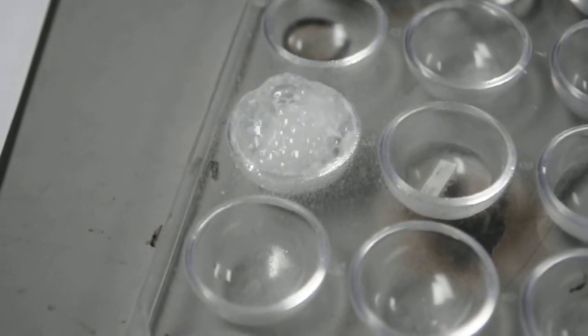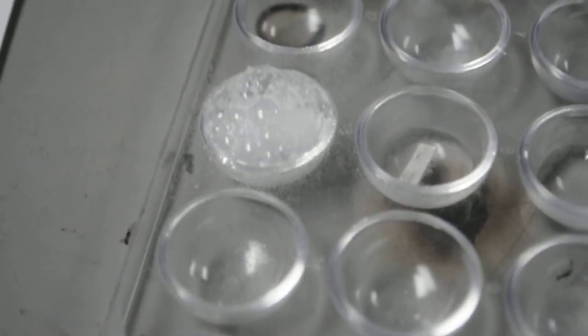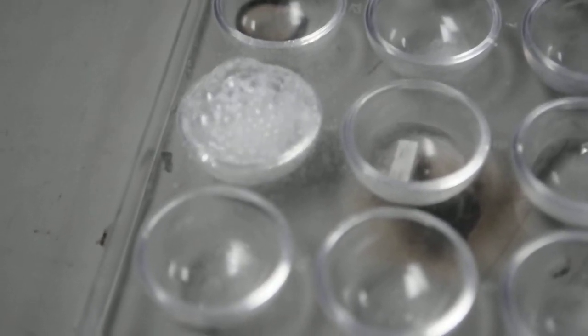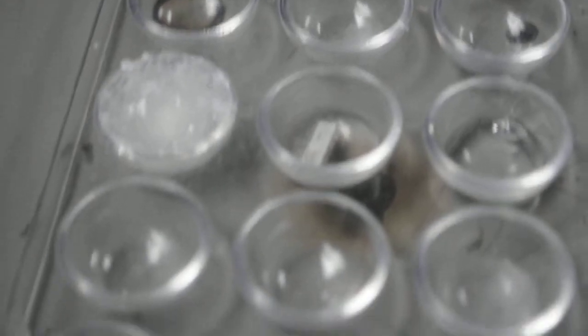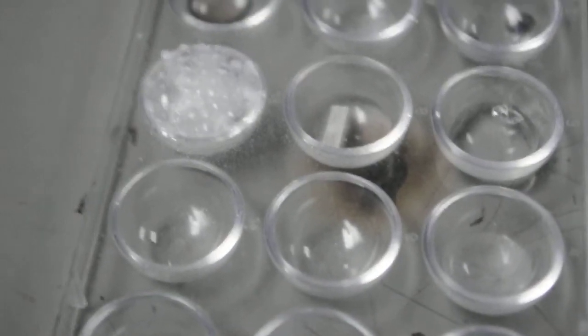There's that calcium going to town again. And is the magnesium doing anything? I'm seeing it move. Oh yeah! You're getting some good action out of that magnesium.